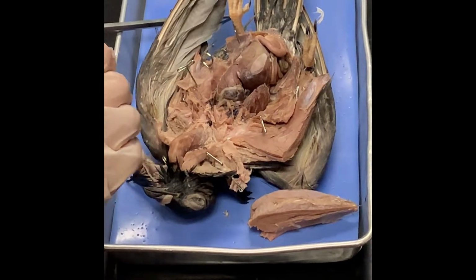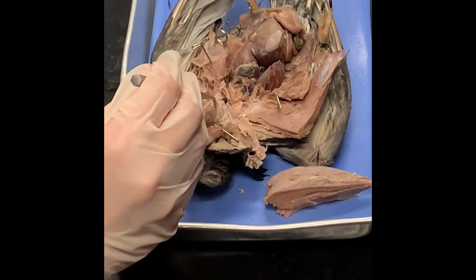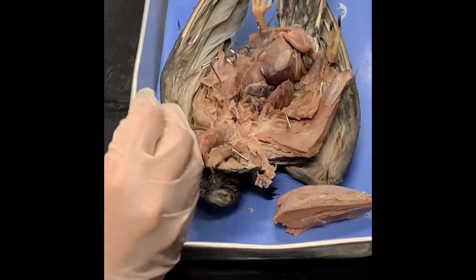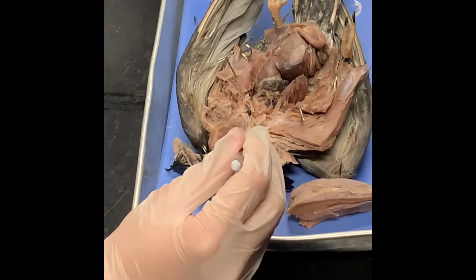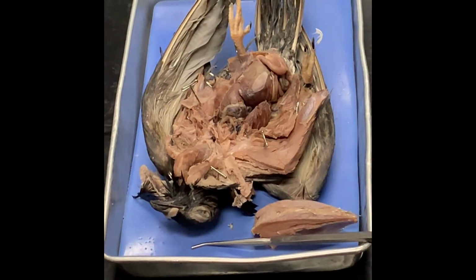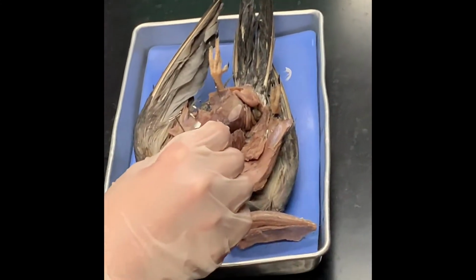All right. So let's see, internal anatomy. What do we got going on here? So your crop, you said you guys busted a little bit. Which tends to happen. Here's what's left of it. So what's the crop exactly? It was like a whole sack. The crop is a food storage, the beginning of the digestive system. Most of the digestive system, until we get to the intestines, is kind of buried underneath the rest of the organs.